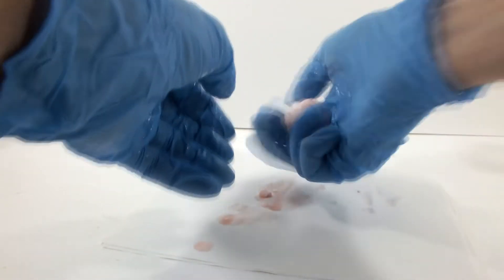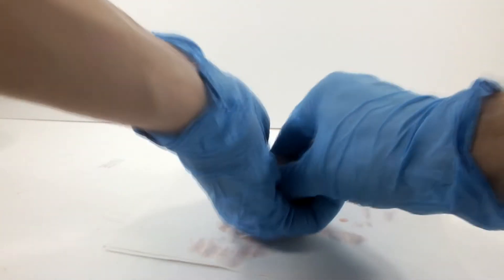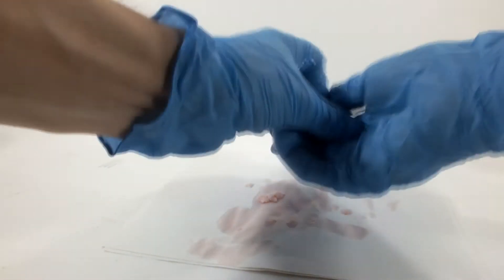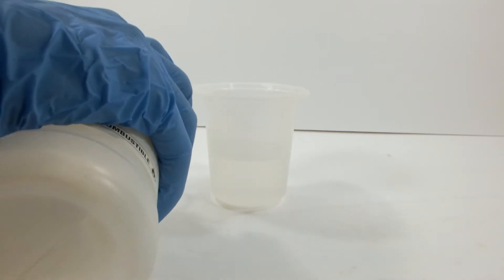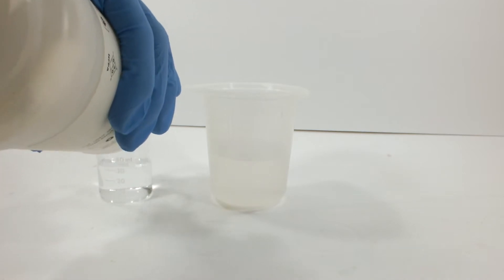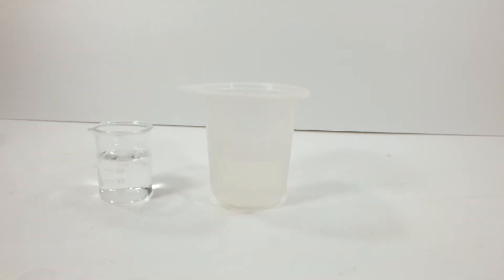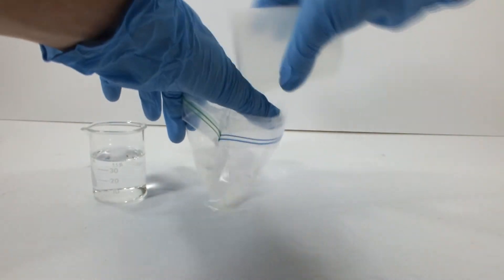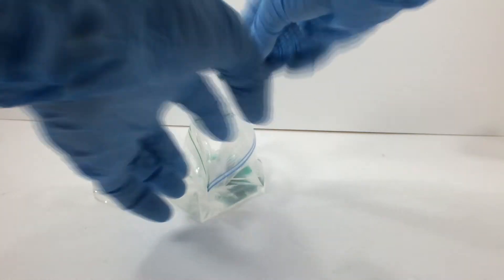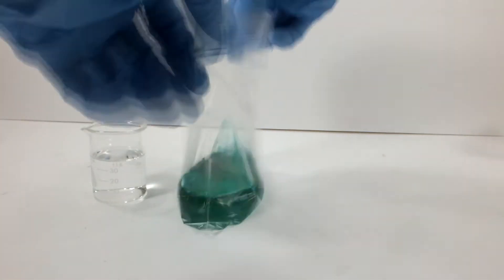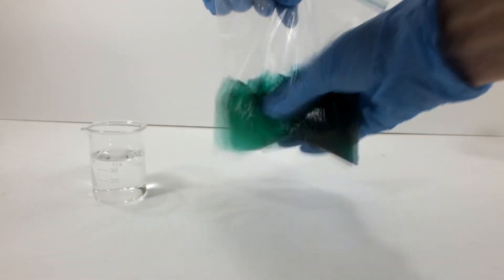Another thing I noticed is that there's an awful lot of extra water left behind. I wondered why I was adding water, only to have it come out of the polymer later. In the next run, I'm going to try and eliminate that problem. I also decided to scale up. I had 110 milliliters of the sodium silicate solution, and I figured that about 40 milliliters of alcohol would be proportional. Without any additional water, I mixed these two solutions together. The question I had was whether removing the water is going to help polymer formation or somehow inhibit it.